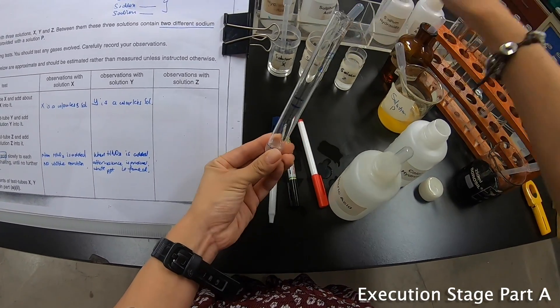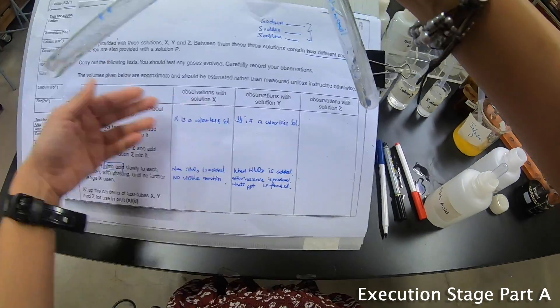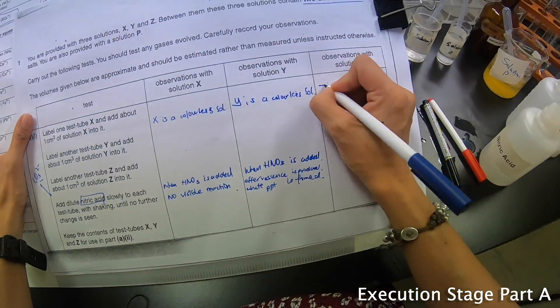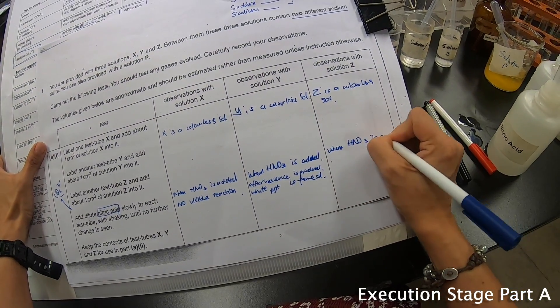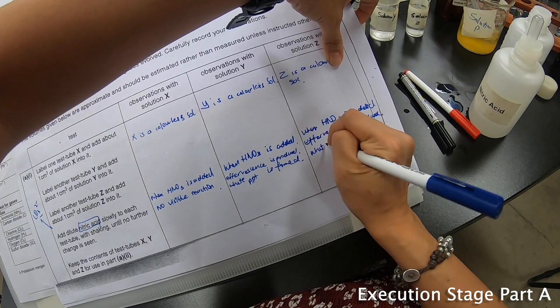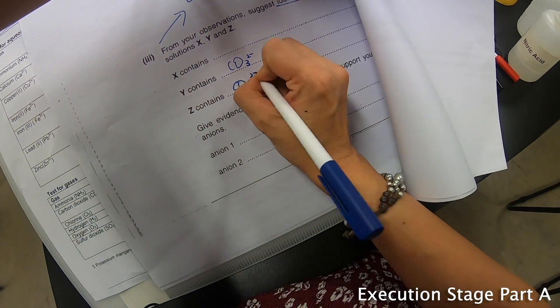Z — 1 cm³ — add acid. White precipitate is observed and effervescence is produced. The precipitate in the lime water is very obvious now. Z is a colorless solution. When HNO3 is added, effervescence is produced and white precipitate is formed. This shows that Z also contains carbonate, so I write carbonate for Z as well.